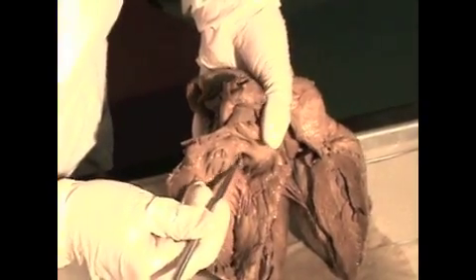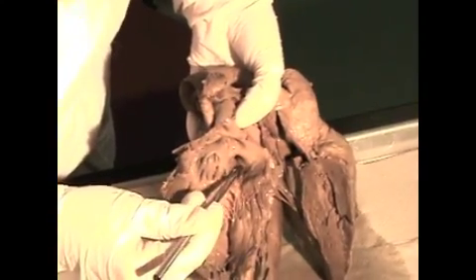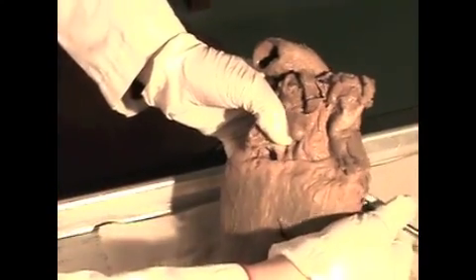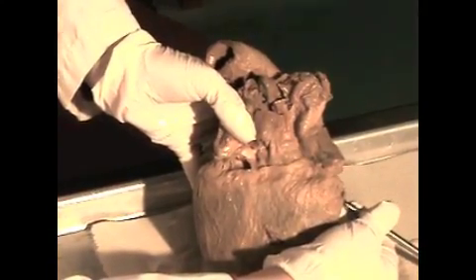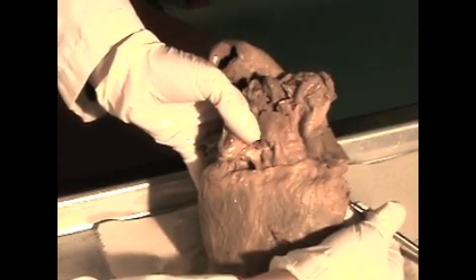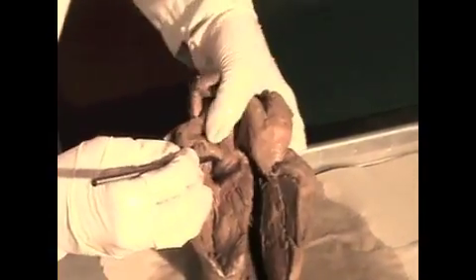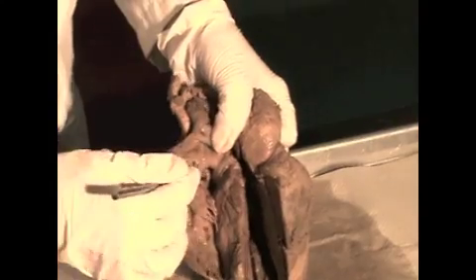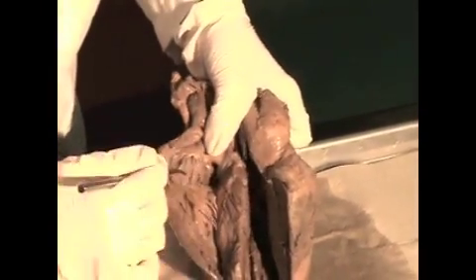This is the opening to the inferior vena cava, and there's a tiny little triangle right below it. That's going to be your opening to your coronary sinus. And if I stick my probe through that, I'm going to find myself out here in that atrioventricular groove or coronary sulcus again, because that's where that vessel lies, even though you can't see it on the surface. So these are the three vessels returning blood to the right side of the heart, to the right atrium. You've got your superior vena cava, your inferior vena cava, and your coronary sinus.